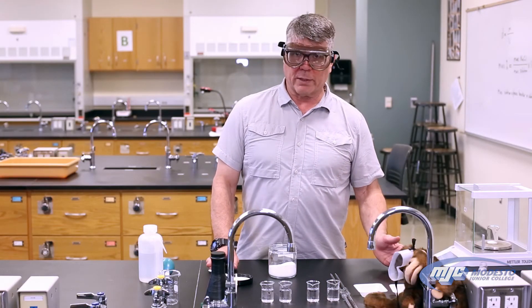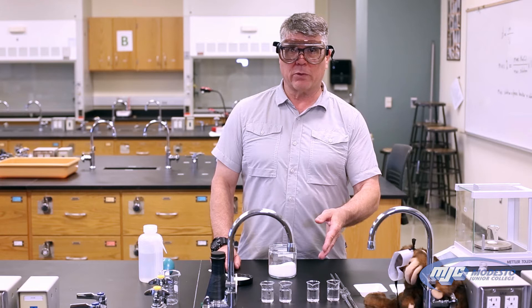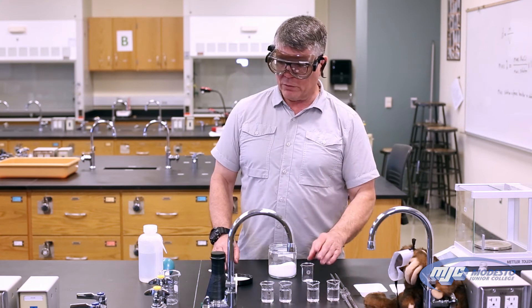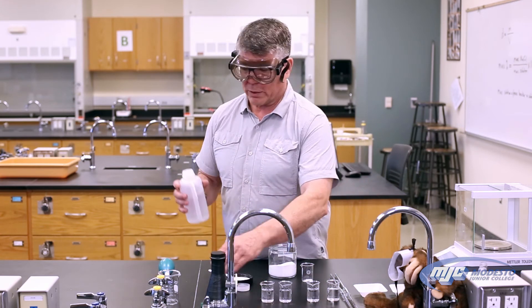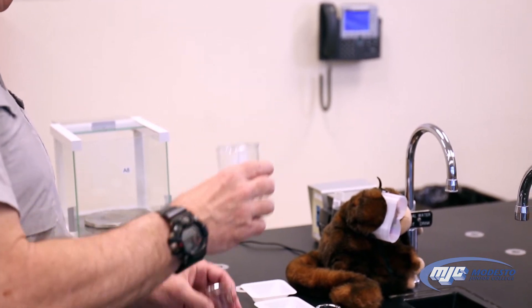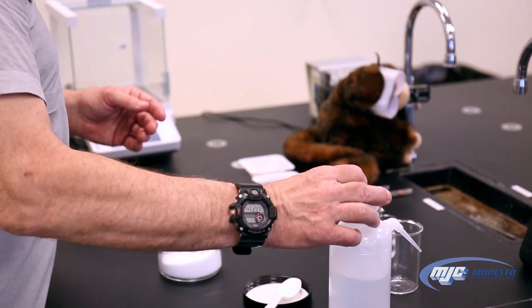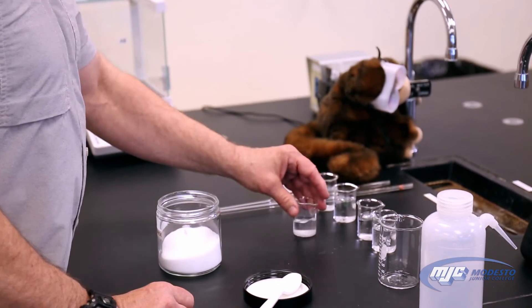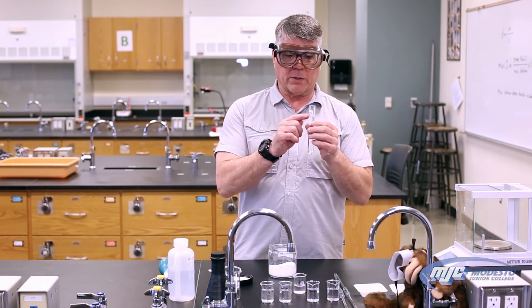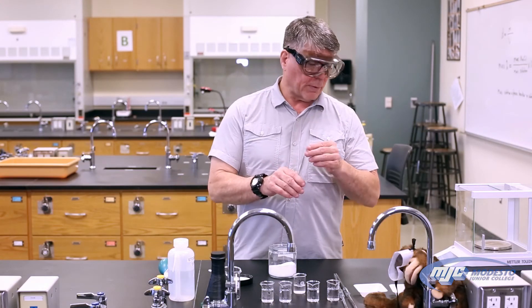We record that number in our data table — that's for beaker one. Then we do the same thing for beaker two: weigh the empty beaker, tare it, add about two grams of sodium chloride, then three, four, and five. Once we have that done, we're going to add about 20 milliliters of deionized water to each of the beakers using the marks on the beaker to measure — pour it in and let it dissolve. I'm going to set that aside; I've already made up the other solutions. While we're waiting for those to dissolve, we can go get our unknown. As always, the unknown has an unknown number, so you take that off and make sure you record it in your data table as well as your conclusion.